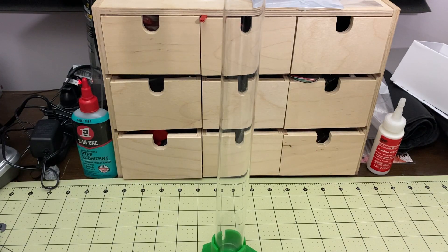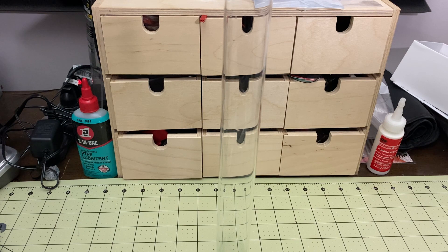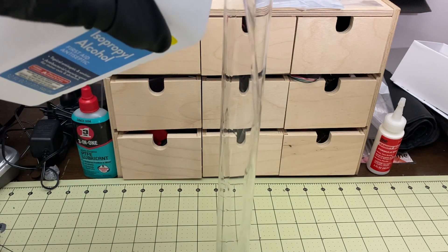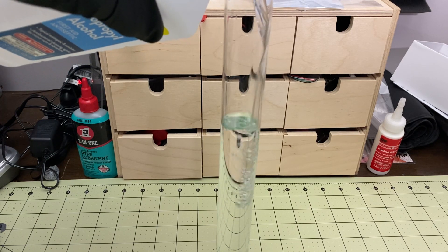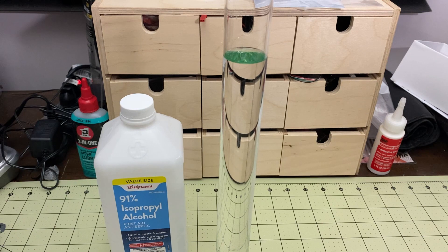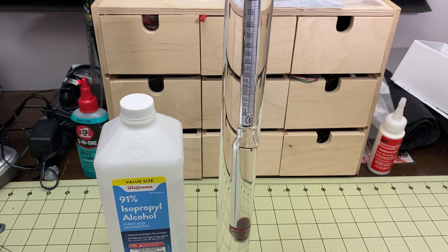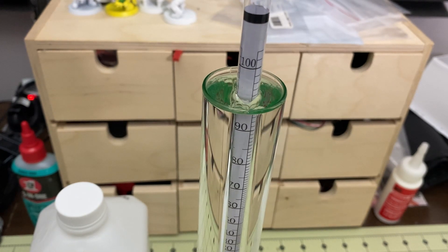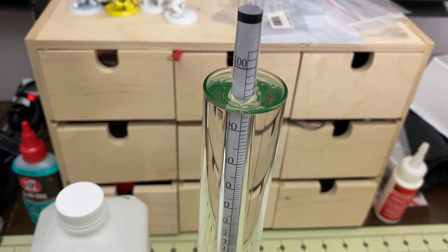That's all emptied out — there's a little residue, and I'll note there's minor cross-contamination, but it'll be very minor in the long run. Now we're testing the Walgreens IPA. It reads 95, and once I subtract the 4 for temperature adjustment, I'm right at 91. That looks awesome — it works exactly the way it's supposed to.